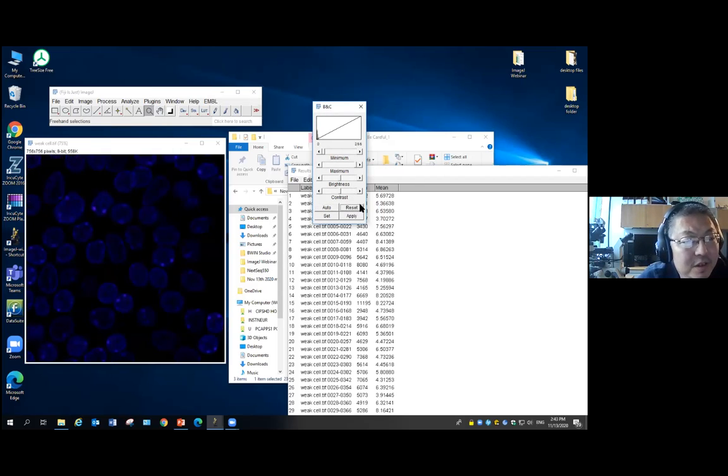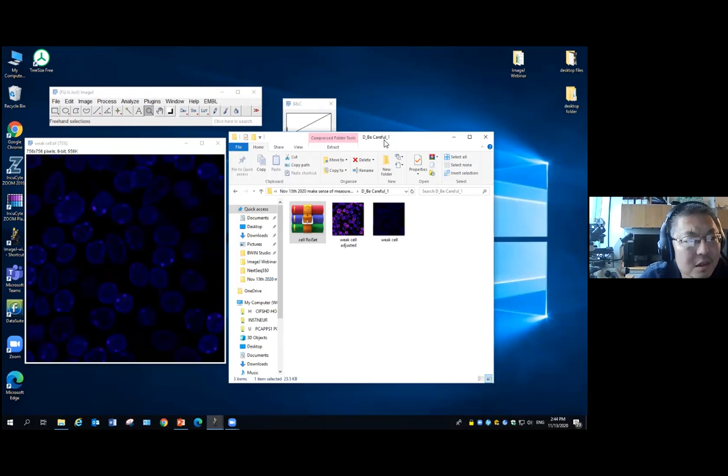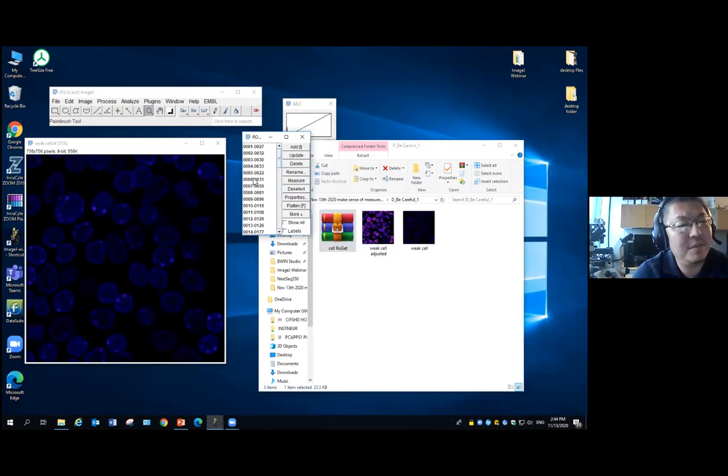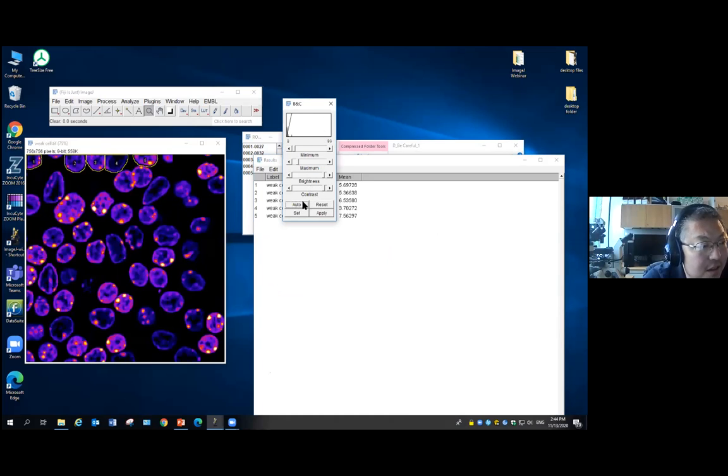As here, if we reset it, let's just do it again. To make it simple, I'm just going to delete here. I only show 5 of these cells. I do a measurement. You can see the intensity is actually quite low, but I want to see more clearly what the image is like. I click Auto. Now you can see I see the cell much more clearly.